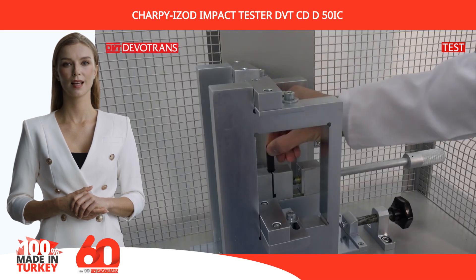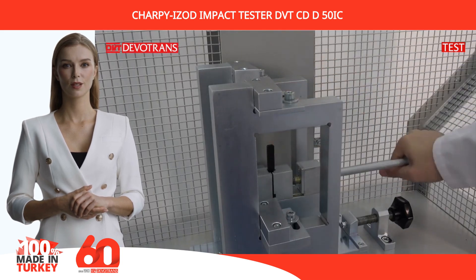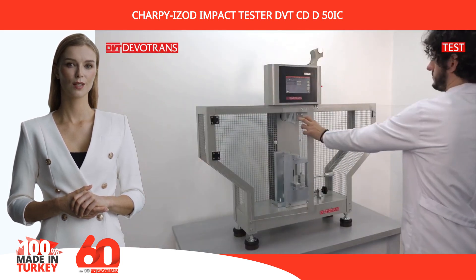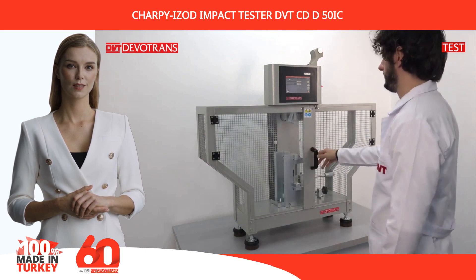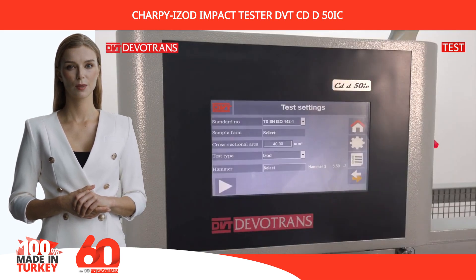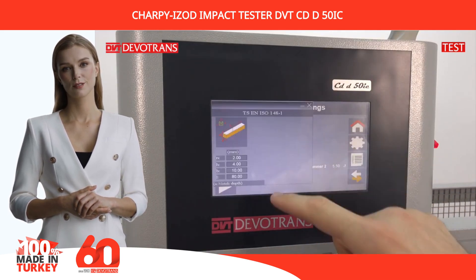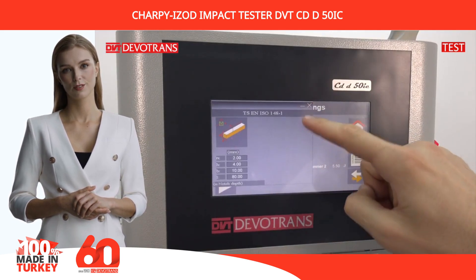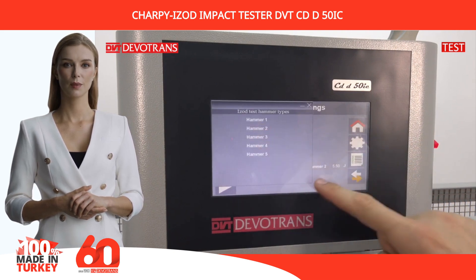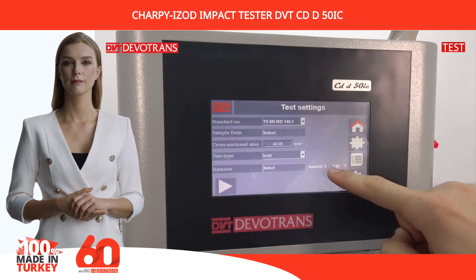Charpy and Izod tests are impact tests performed on notched material specimens. Their primary purpose is to determine the fracture energy and behavior of a material under an impact force.